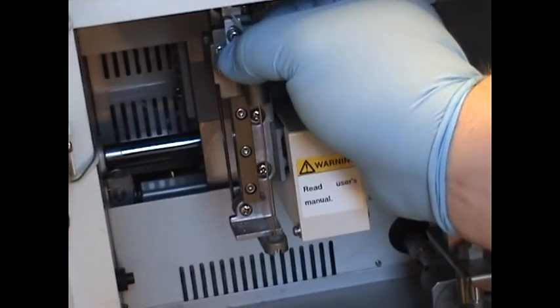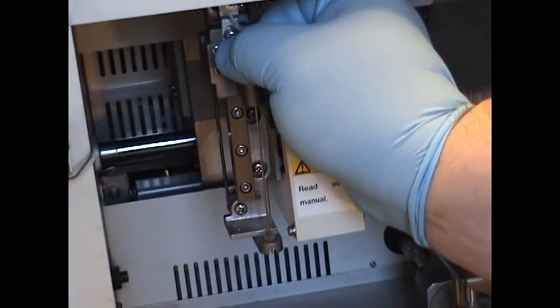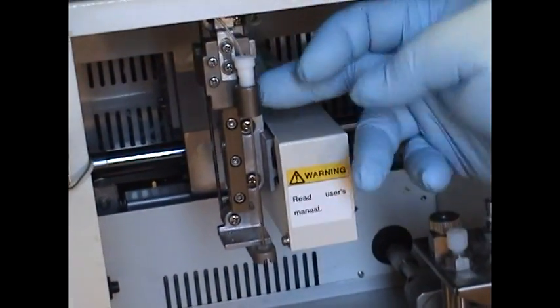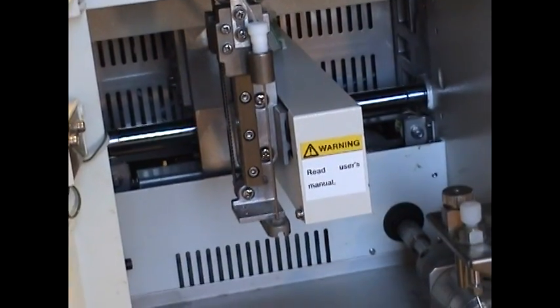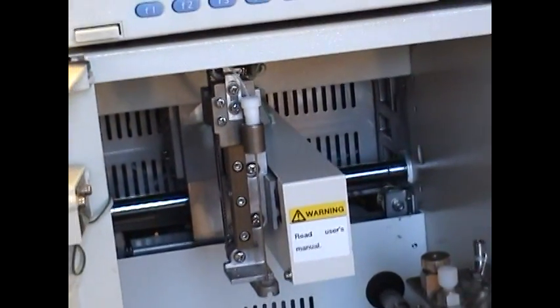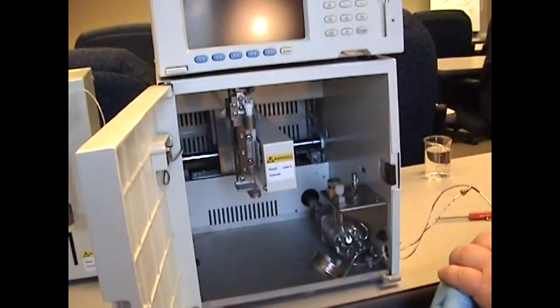Make sure that's snug. Keep it in the upright position. And there you go. That's the final procedure for changing out the needle.